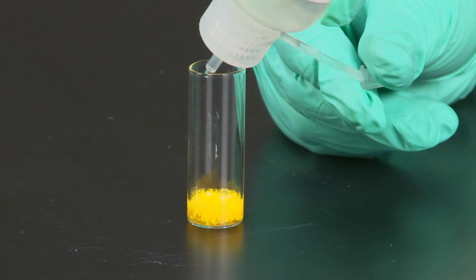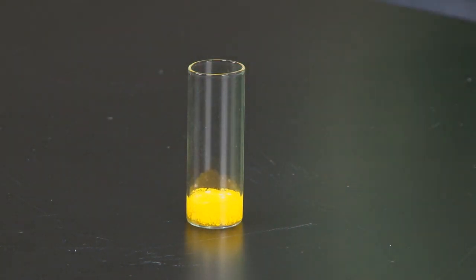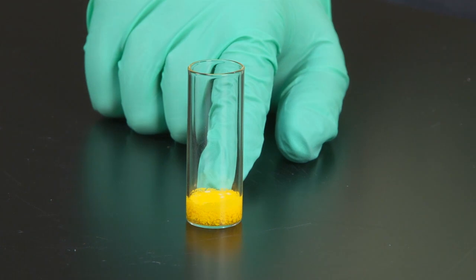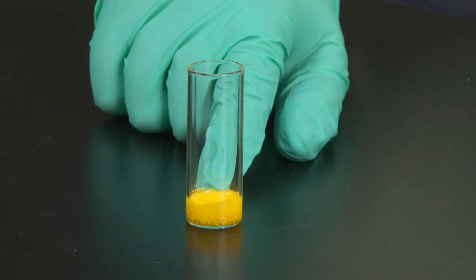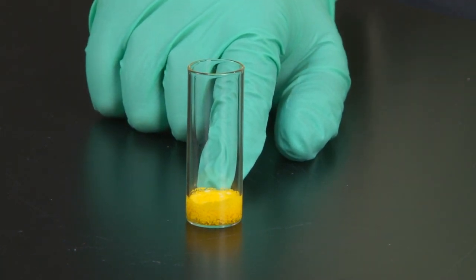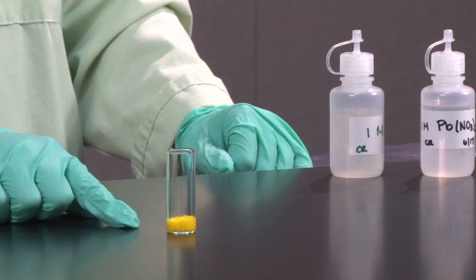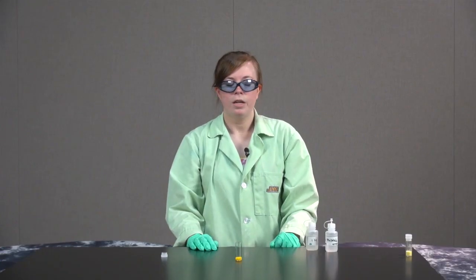As you can see, this reaction almost instantaneously produced a precipitate of yellow lead iodide. There's also some aqueous potassium nitrate there, but this reaction happened a lot faster than the solid phase reaction.